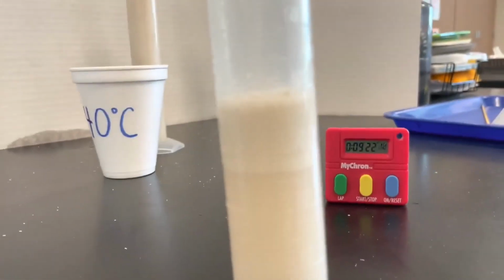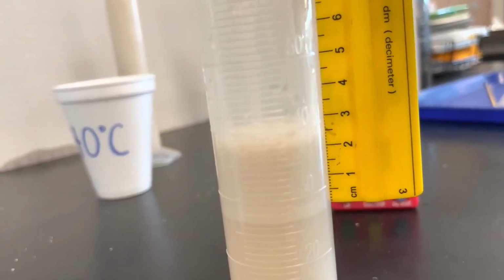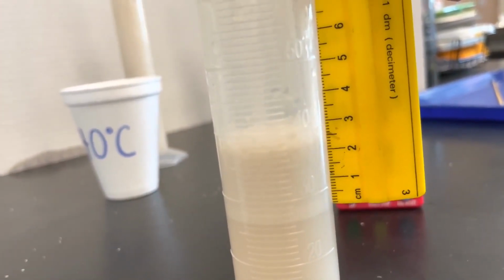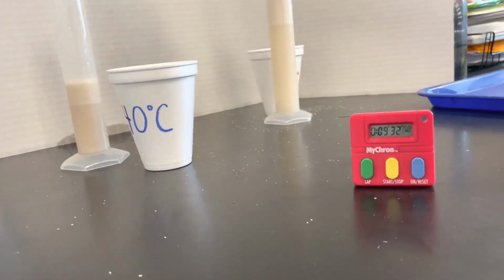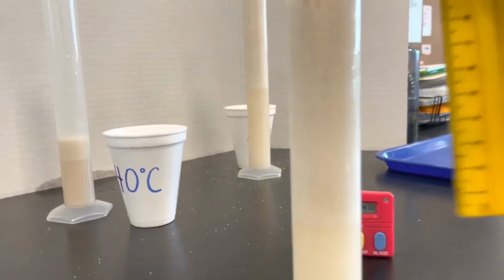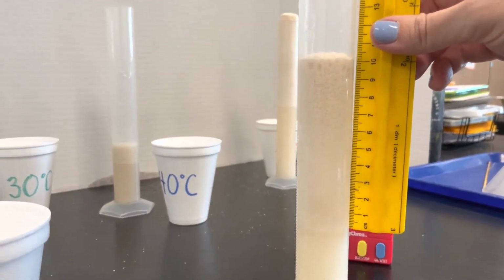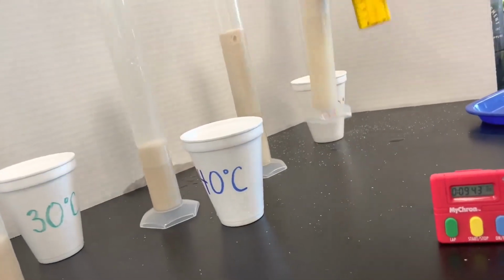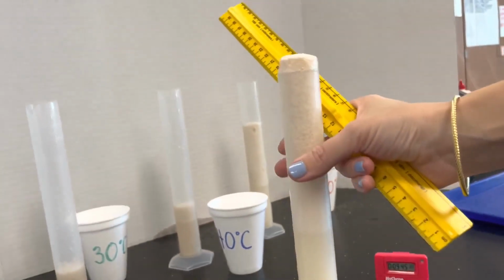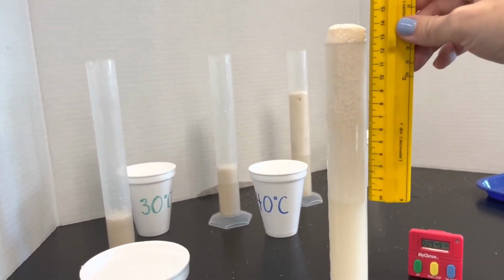This is for 9 minutes, 30 degrees Celsius. 40. And this is 50.